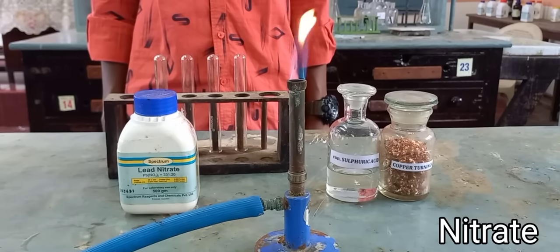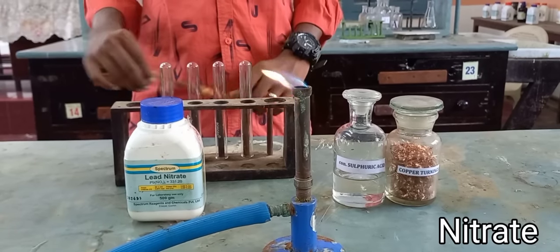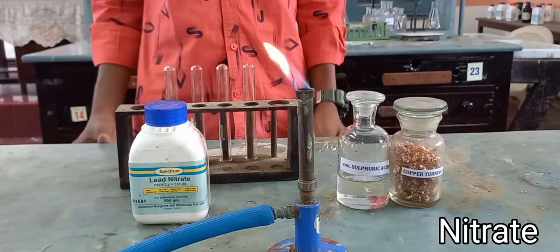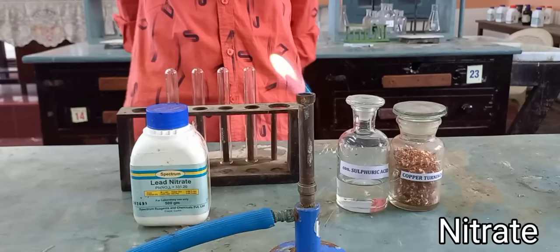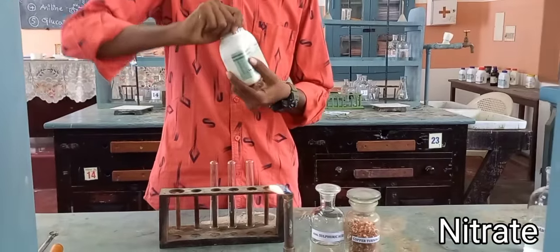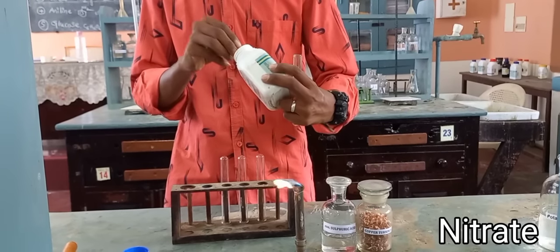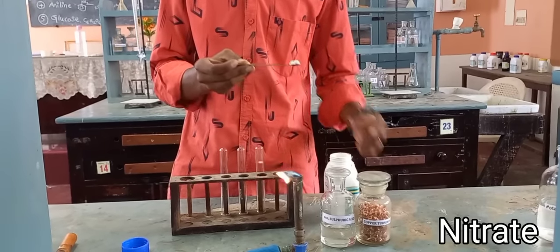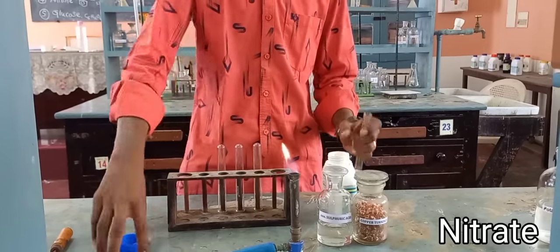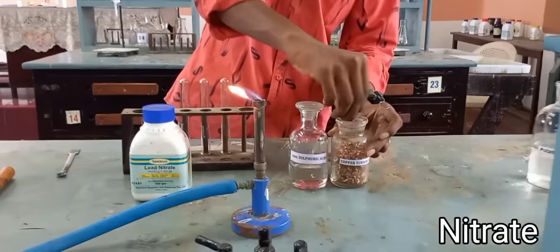For the nitrate acid radical test: take lead nitrate salt, put a spatula in a test tube, add a pinch of copper turnings. Add concentrated sulfuric acid to one spatula of lead nitrate and one spatula of copper turnings.